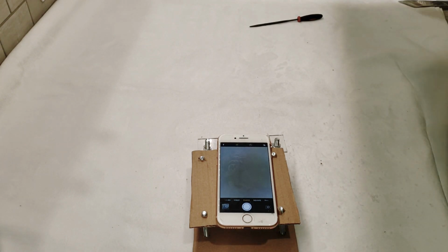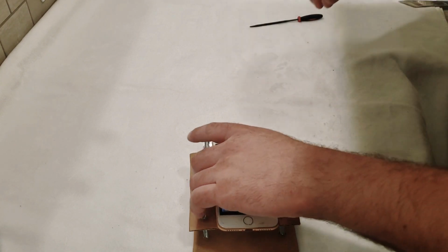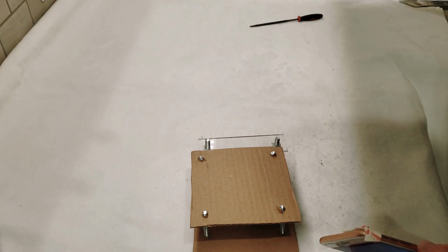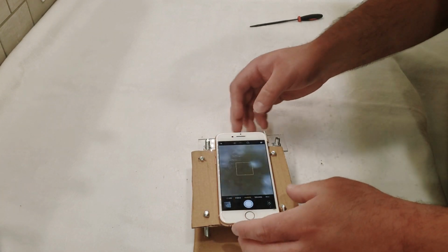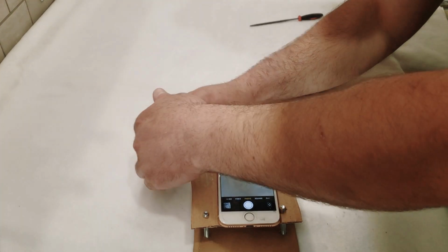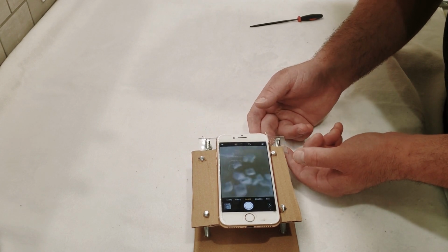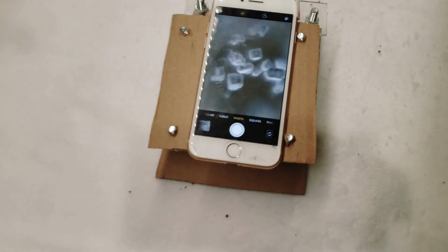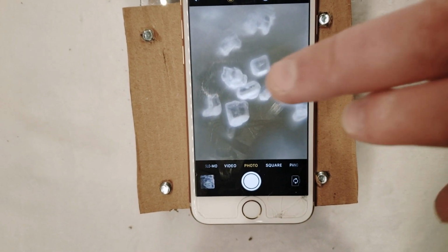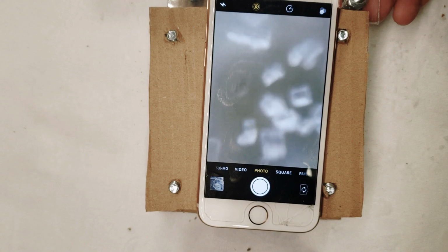For some simple ones, we're just going to take a little bit of granular sugar and sprinkle it on the slide right around where the lens is at. And if we put this down now, we're not getting a very good focus on it, so let's bring both sides up a little bit. Now I'm going to bring you a little bit closer in, and yeah, you can see that that is a much clearer picture. Maybe we could even adjust this a little bit.